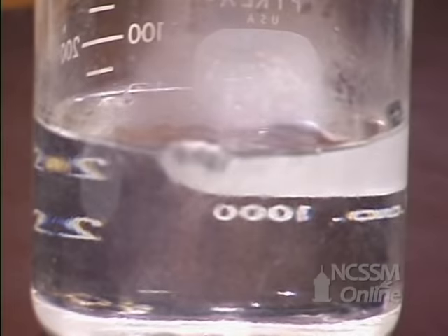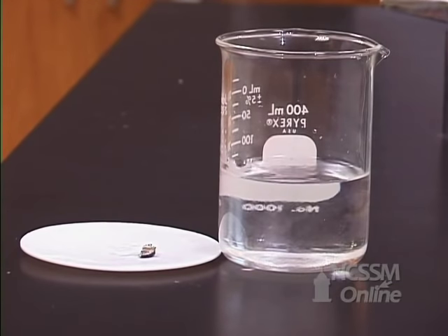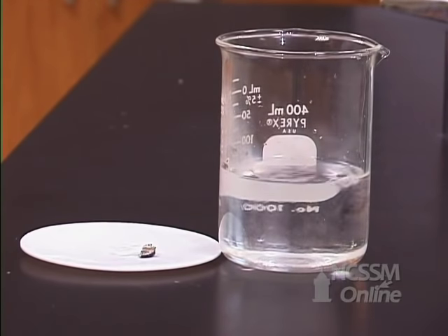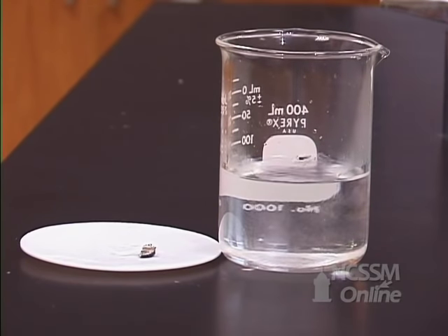This is a single displacement reaction producing hydrogen gas and lithium hydroxide. The lithium hydroxide is very water soluble and dissolves in the water. The hydrogen gas escapes.